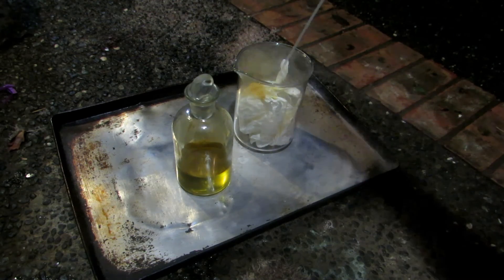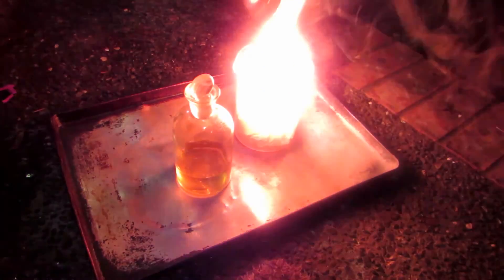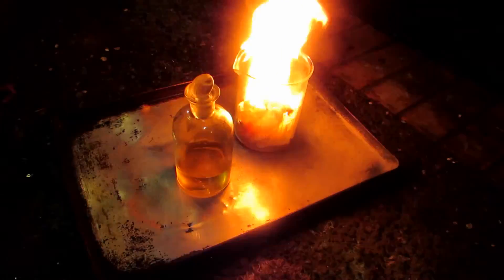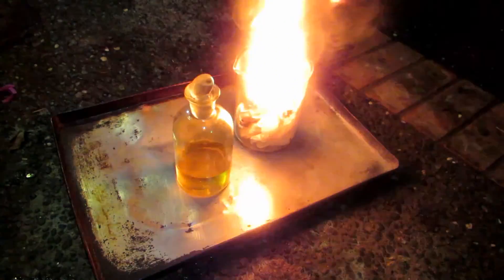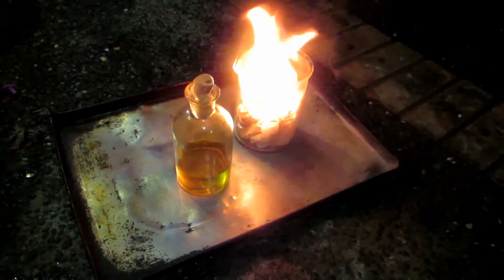Note the vigorous reaction that's going to be happening. You can see immediately they burst into flames — this violent exothermic reaction happens. And if you had that on your hands, you would not be feeling very good; that would really hurt a lot.